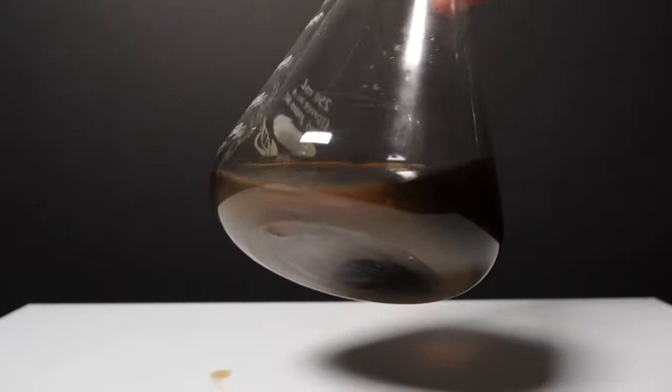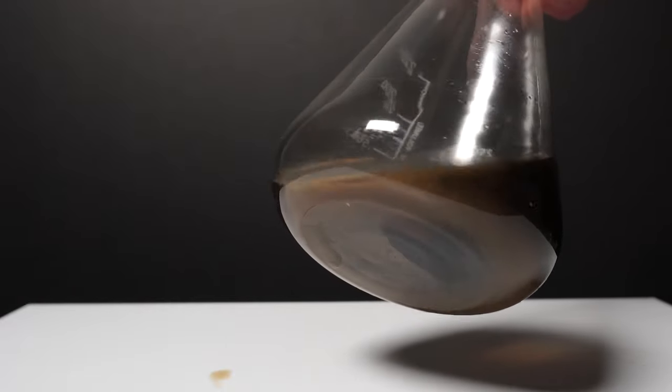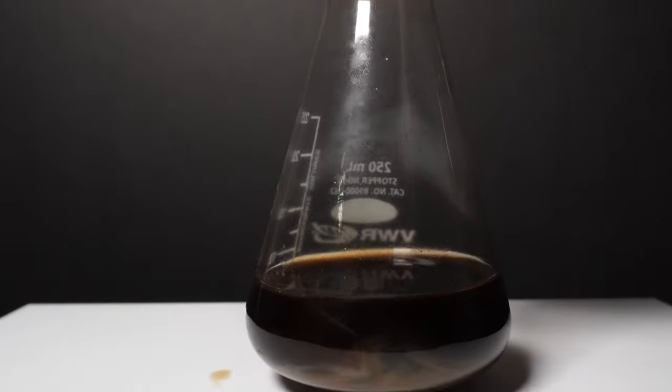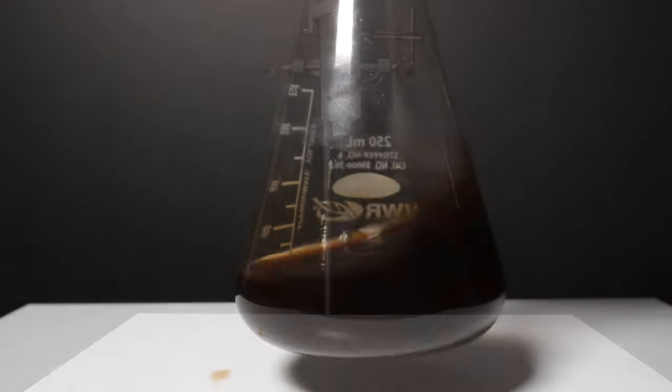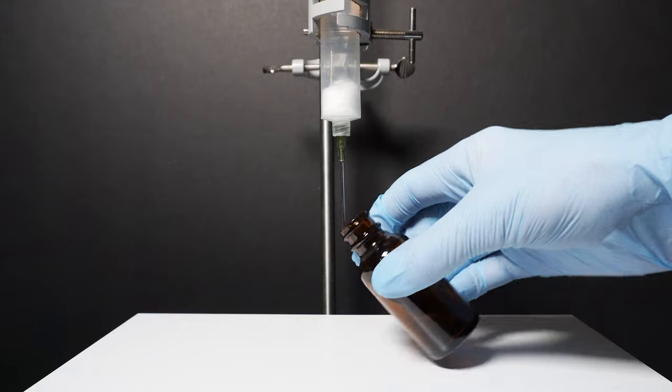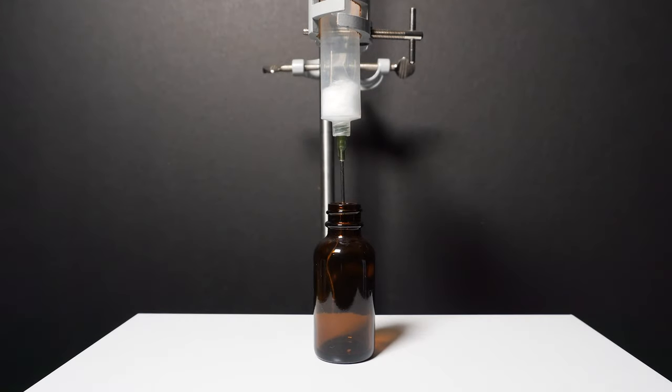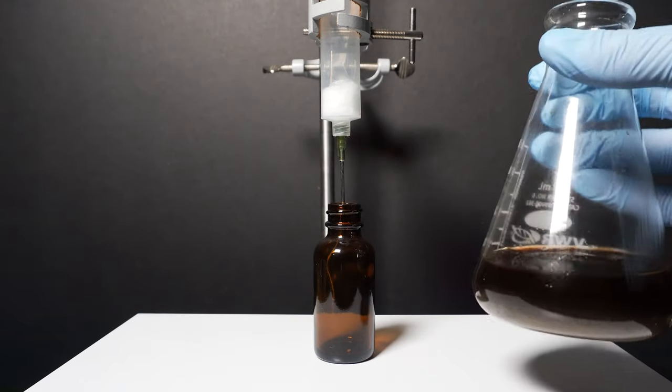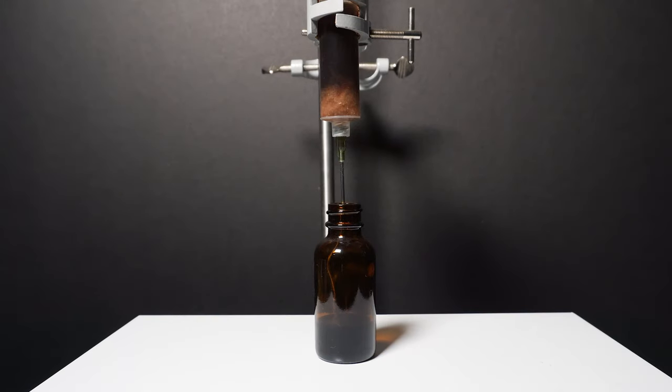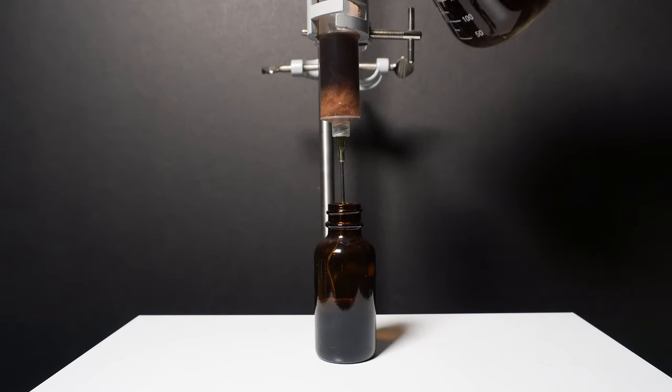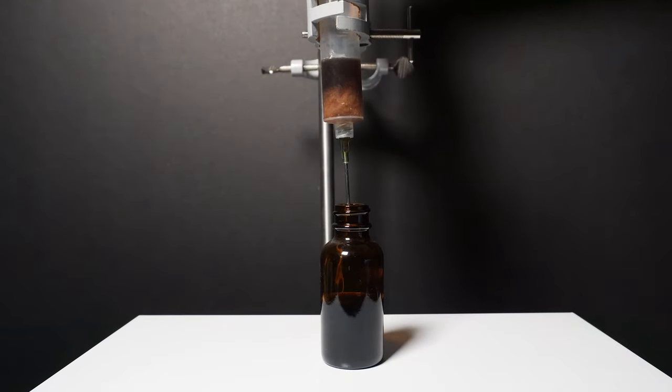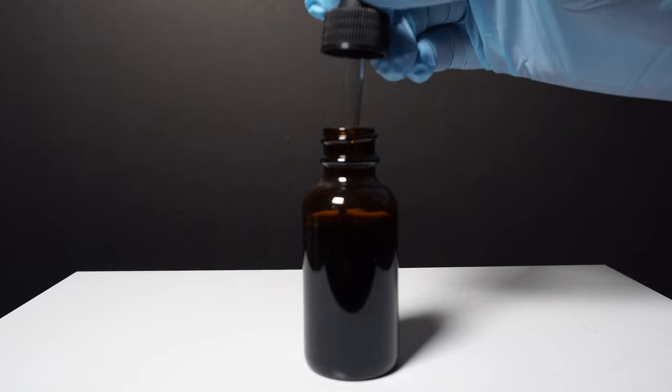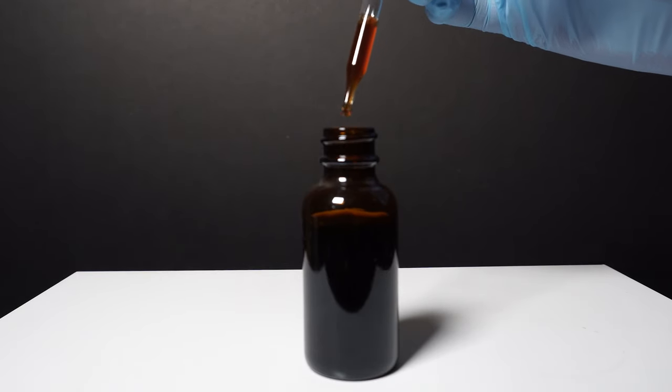Now back to the oil and water I strained from the lavender in the boiling flask. We can see after a few hours all of the smaller particles have sunk to the bottom. We easily filter off these with some cotton. Since I have so little I decided to filter it through a syringe. We can now see that the oil which is still pretty dark but it is much more clear and we can actually see through it.